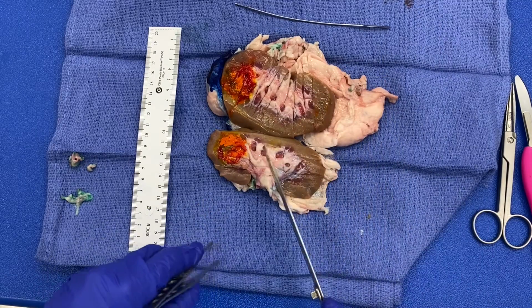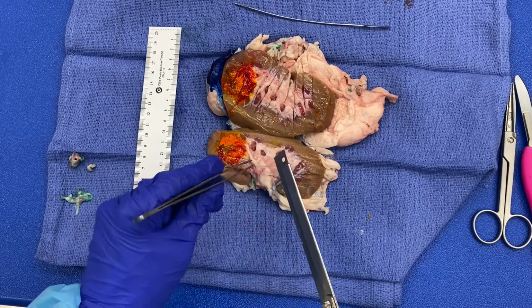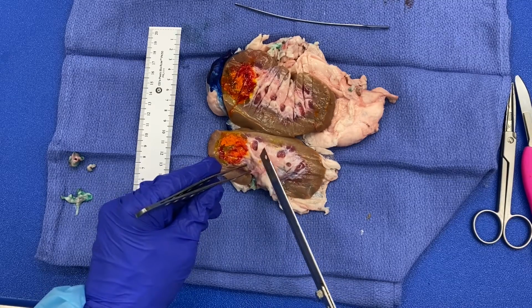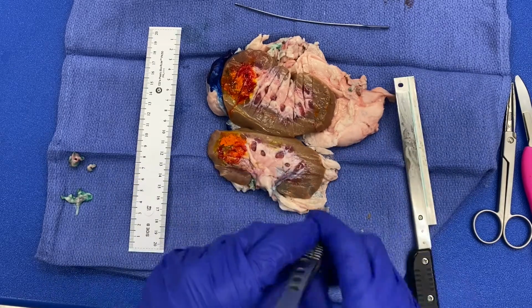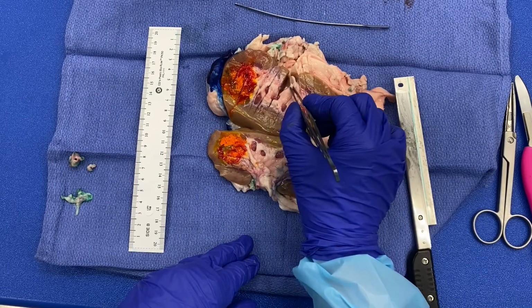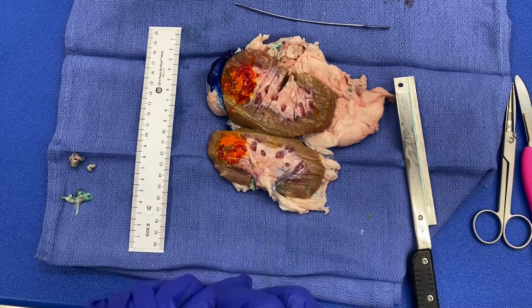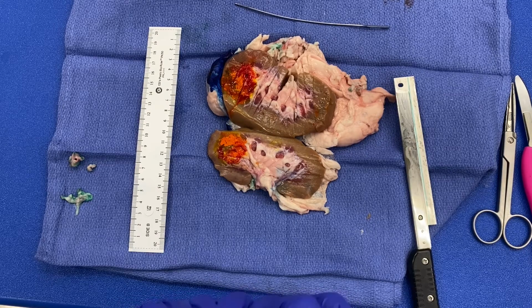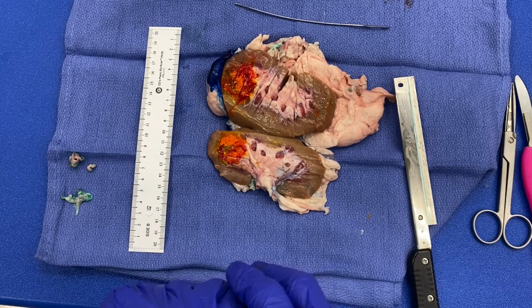One thing about sectioning I'd like you to keep in mind is that one of the most important sections you will take is your tumor in relationship to, and in the pig it's this white tan adipose tissue, the renal sinus fat. So that is all the adipose tissue that is basically housed within and underneath your renal pelvis mucosa. Invasion into renal sinus fat is associated with a poorer prognosis and needs to be documented not only in your gross description, but represented with the cassettes that you submit for permanent section.